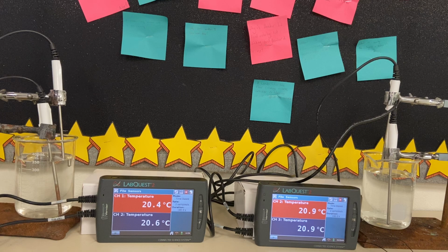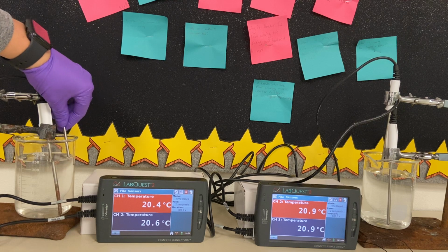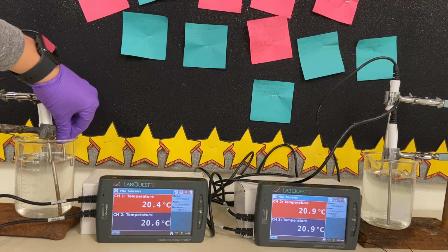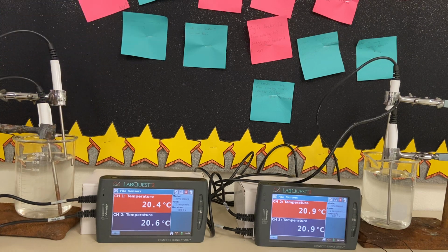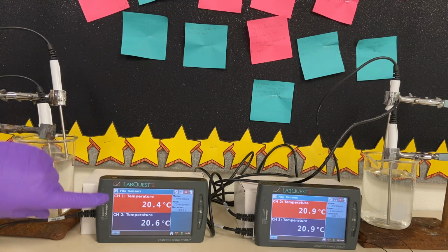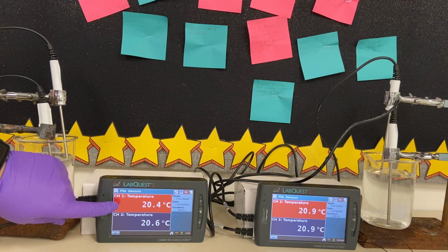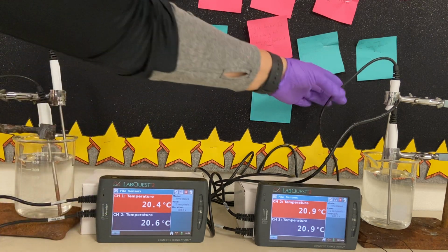The temperature probes, you're going to see, if I touch this one here, it might take a minute just because I've got a pair of gloves on. Okay. Maybe I won't touch it, but on this beaker setup, the channel 1 temperature is the temperature probe at the top of the solution. Temperature 2 is the probe at the bottom of the solution.